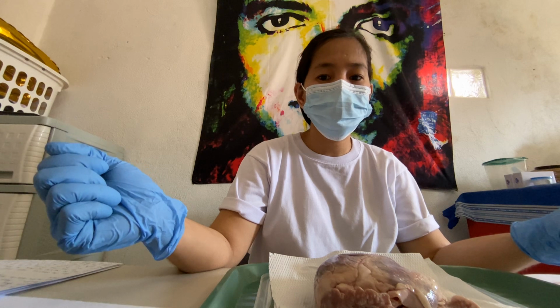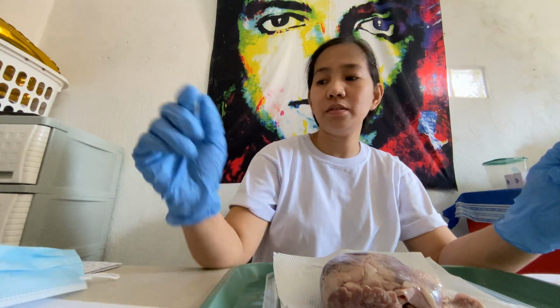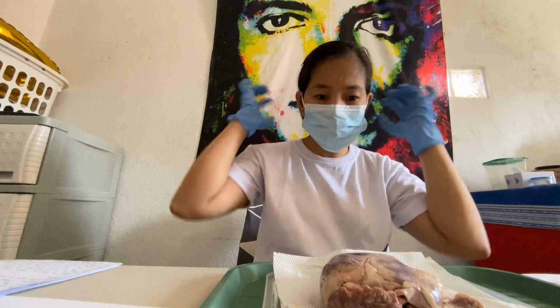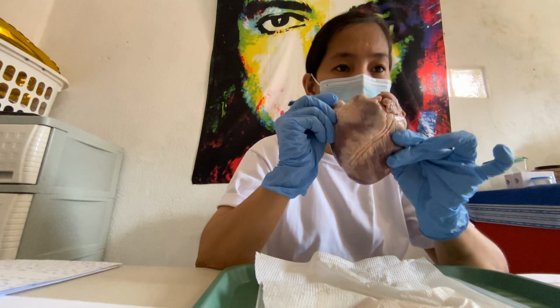I am a student of Bachelor of Science in Psychology at AMA University Online Education. And today I'll be doing my course project for the subject Anatomy and Physiology. Okay, my project is to examine and dissect a pig's heart.